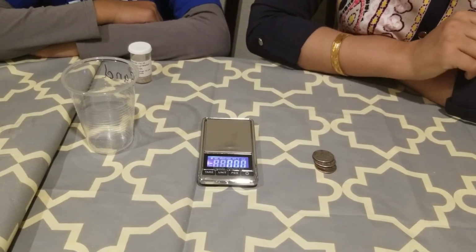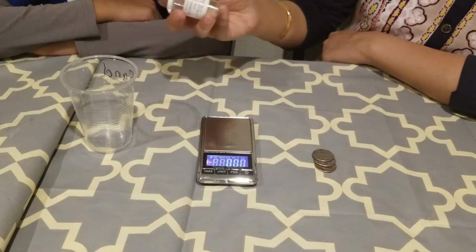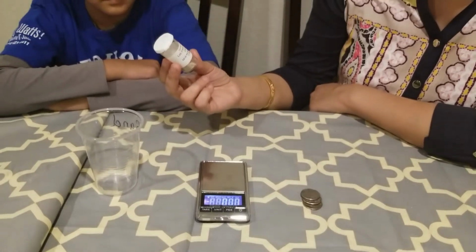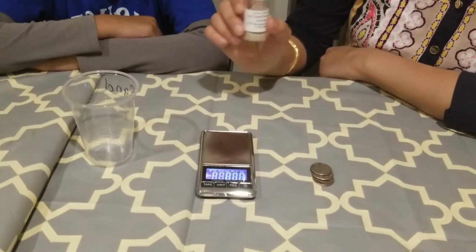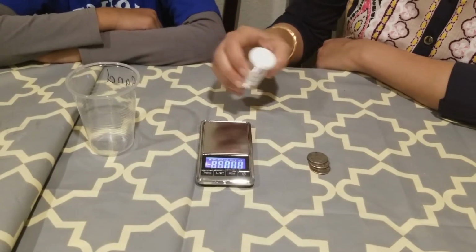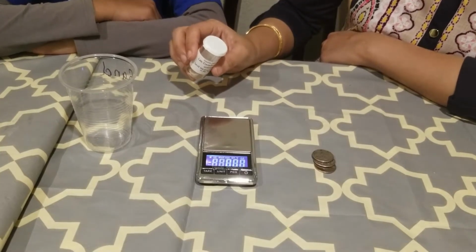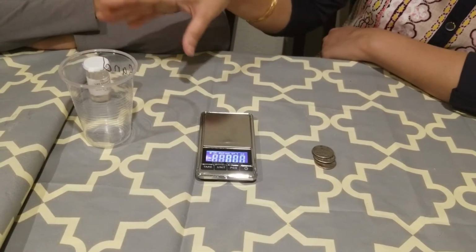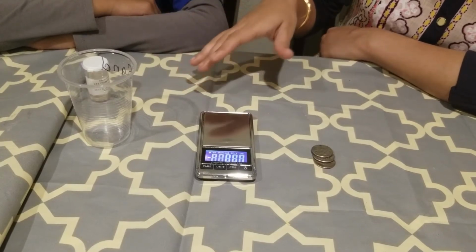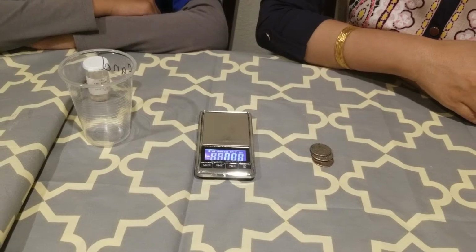Now, in order to perform weighing by difference, I have this salt and sand mixture that I need to take the weight of. If I just simply pour it here on the scale to take the weight, it will be a big mess here. So that is not the best way of taking the weight. The best way of taking the weight in chemistry is weigh by difference. And to do that, the first thing we do is we take the weight of an empty container.